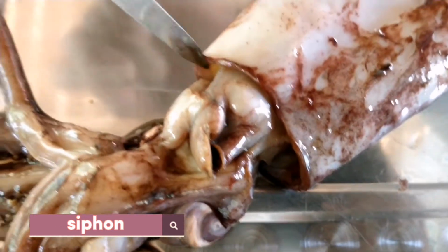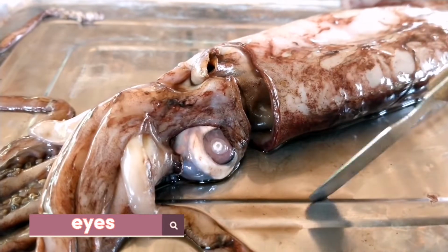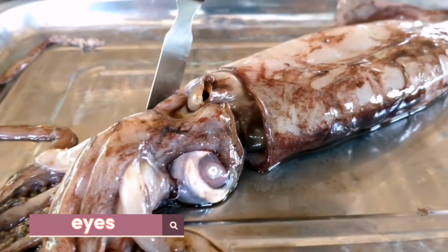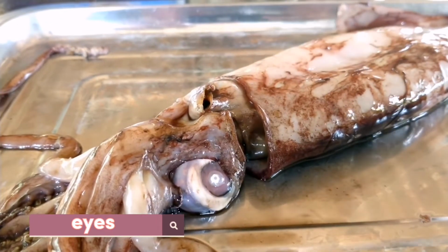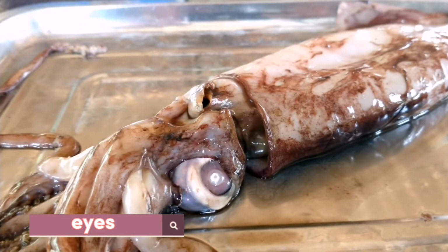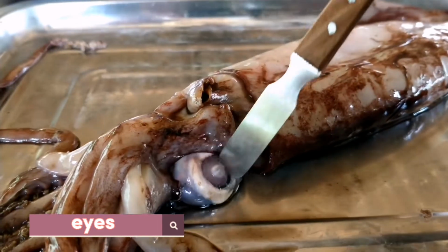Here and over here. These are the eyes of the squid. It is large and there is one on each side. The squid's eyes are similar to human eyes because they are both described as camera eyes, with a lens, and this is the lens of the eyes.